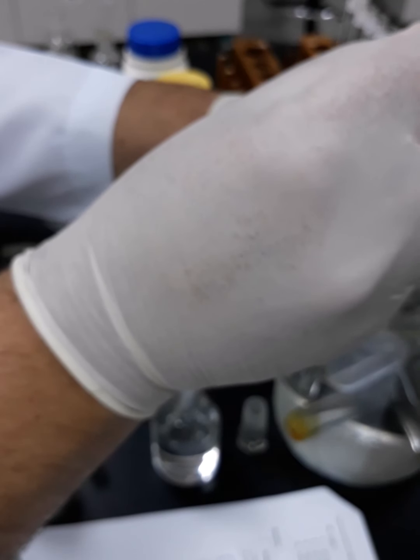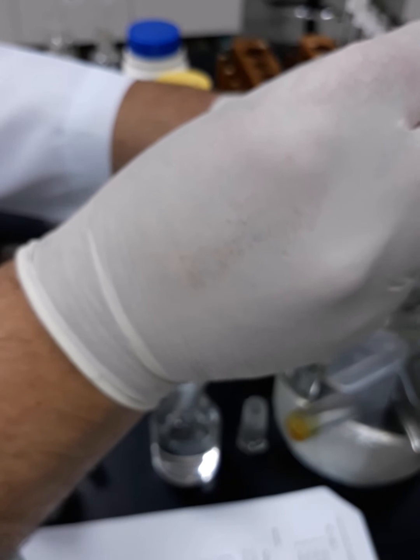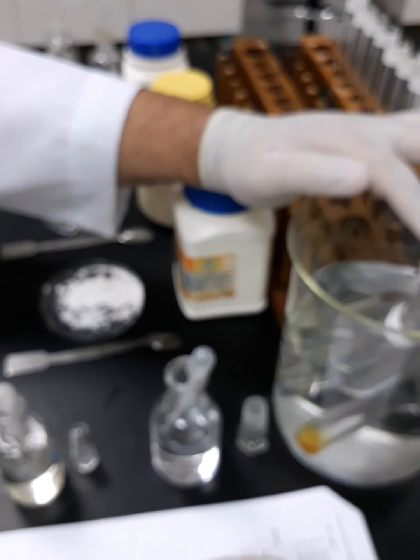Okay, so now for the triethylamine, the last one. 1, 2, 3, 4, 5. Okay, so now I added it to the triethylamine, but again there are no bubbles. So we can conclude that the bubbling occurs with tyrosine to a higher extent and occurs in para-aminobenzoic acid and paracetamol, but to a very low extent, and did not happen at all in triethylamine and in diethylamine.